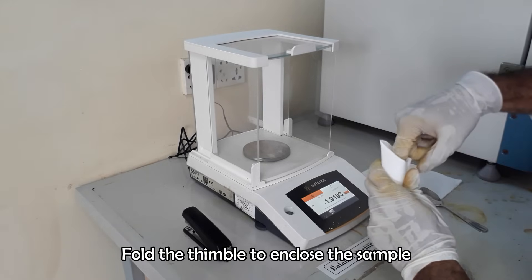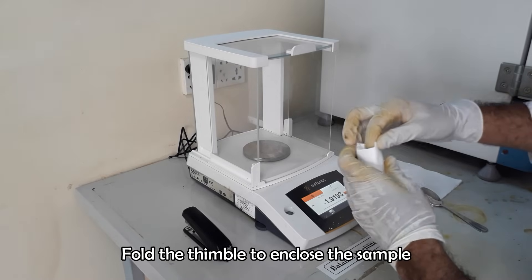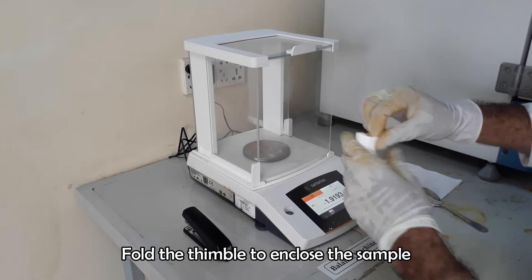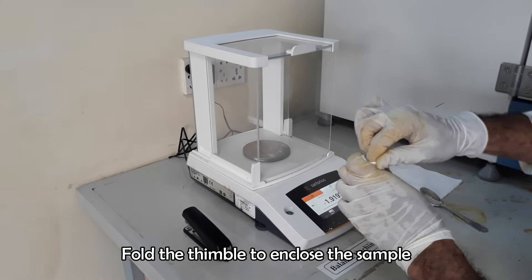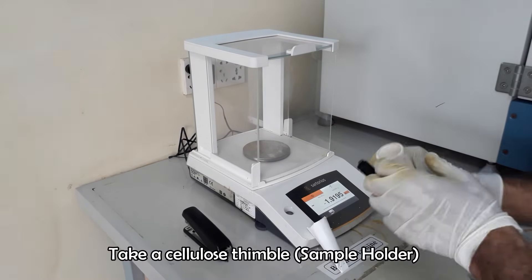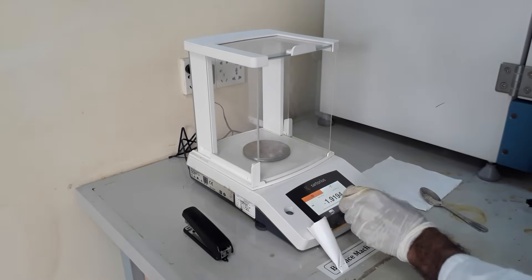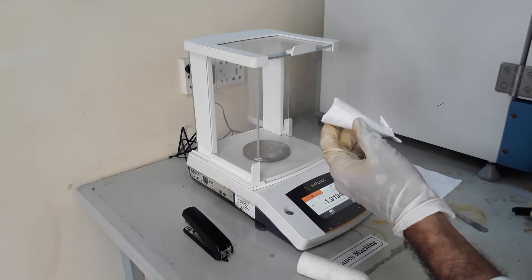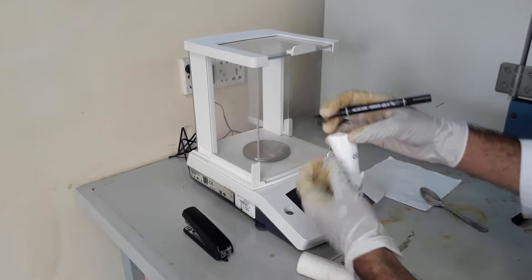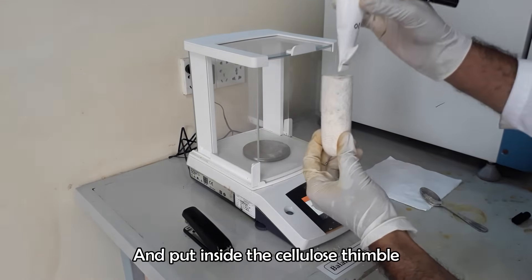Place a small amount of cotton into the thimble to cover the sample. Close the opening end by folding the filter paper. Mark the thimble with the sample number. Take a cellulose thimble and put the enclosed sample into it.